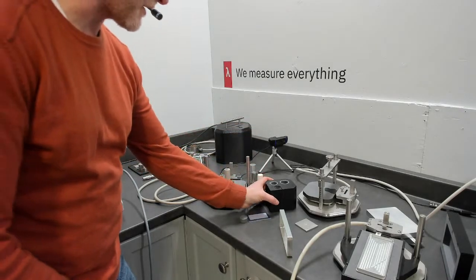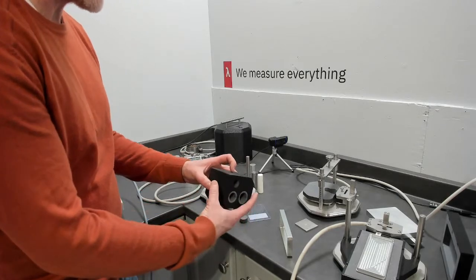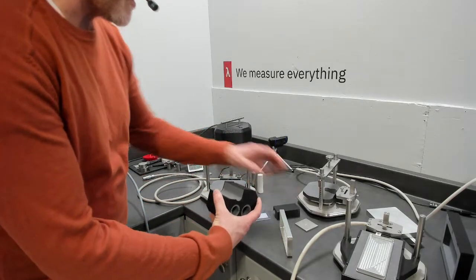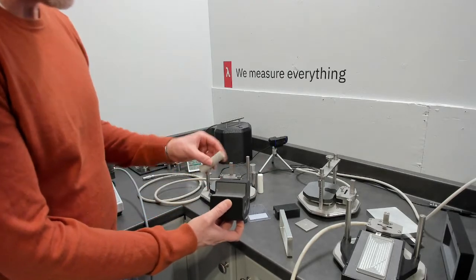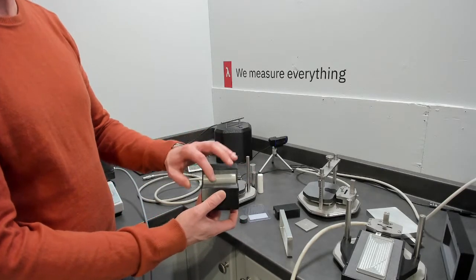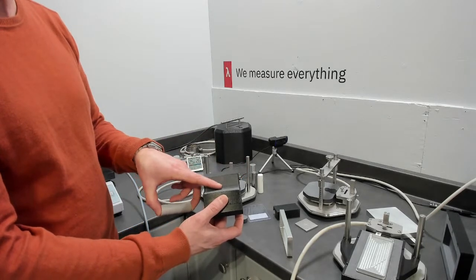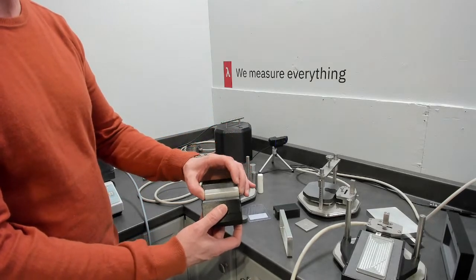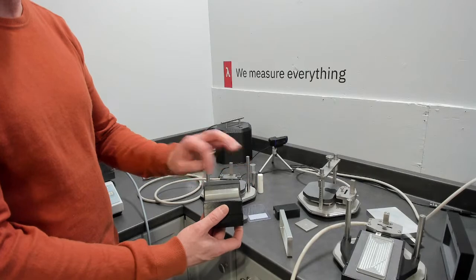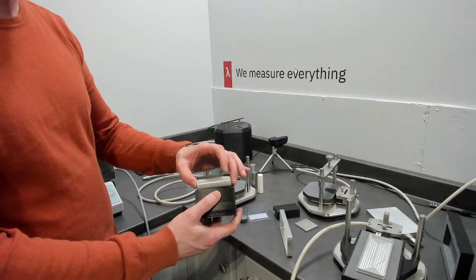There's one more configuration, and that is the asymmetric or single-sided test of that cylinder. We're going to put the sensor in contact with XPS that's been machined out to the radius of the cylinder, in this case 21700. Of course, you would have different dimensions depending on the type and size of cylinder you're measuring.